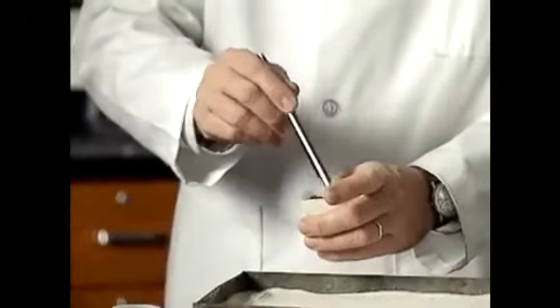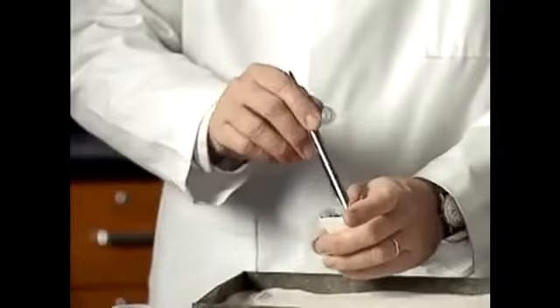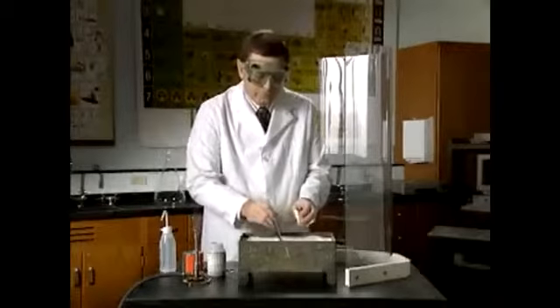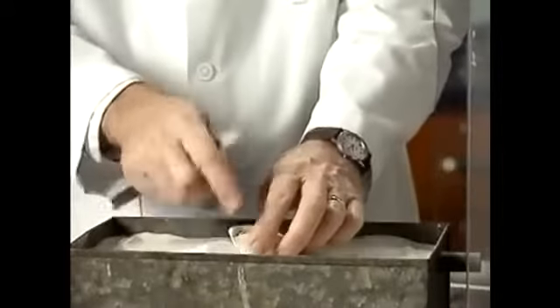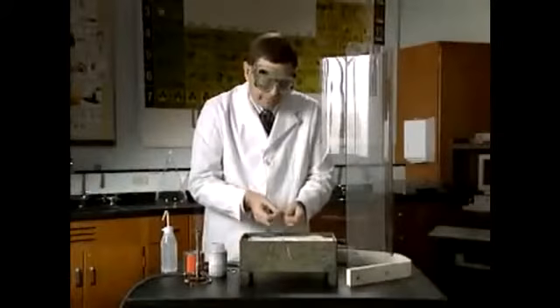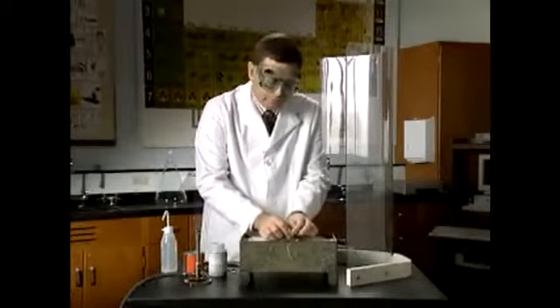This is a powdered material which helps the oxidation reaction. We're going to place that then in a hole in this container of sand. I'm then going to place a piece of magnesium ribbon down into the mixture and move the explosion shield into place before we light the magnesium fuse.